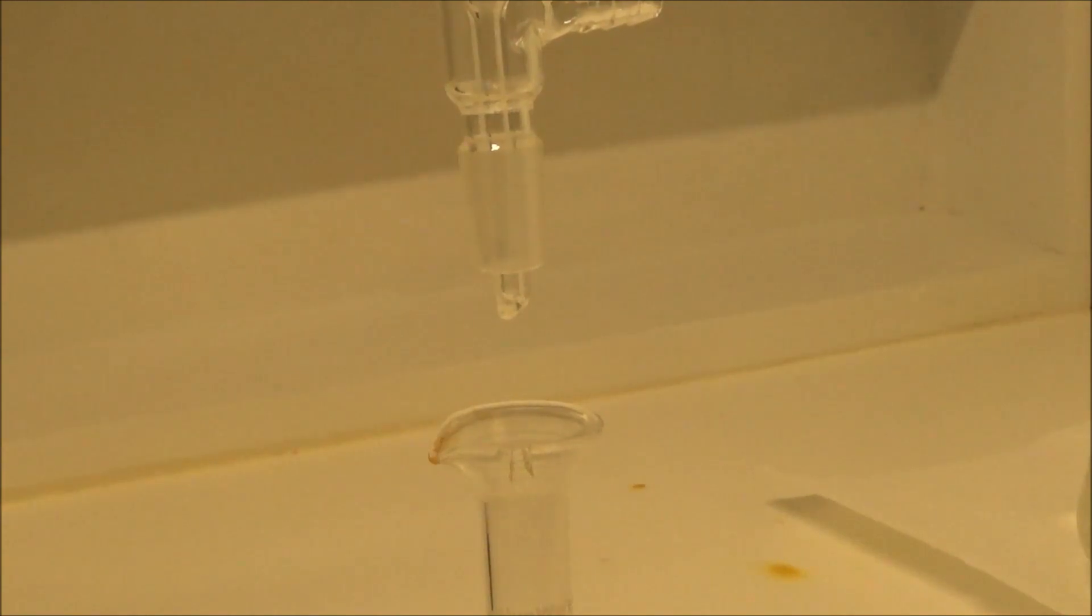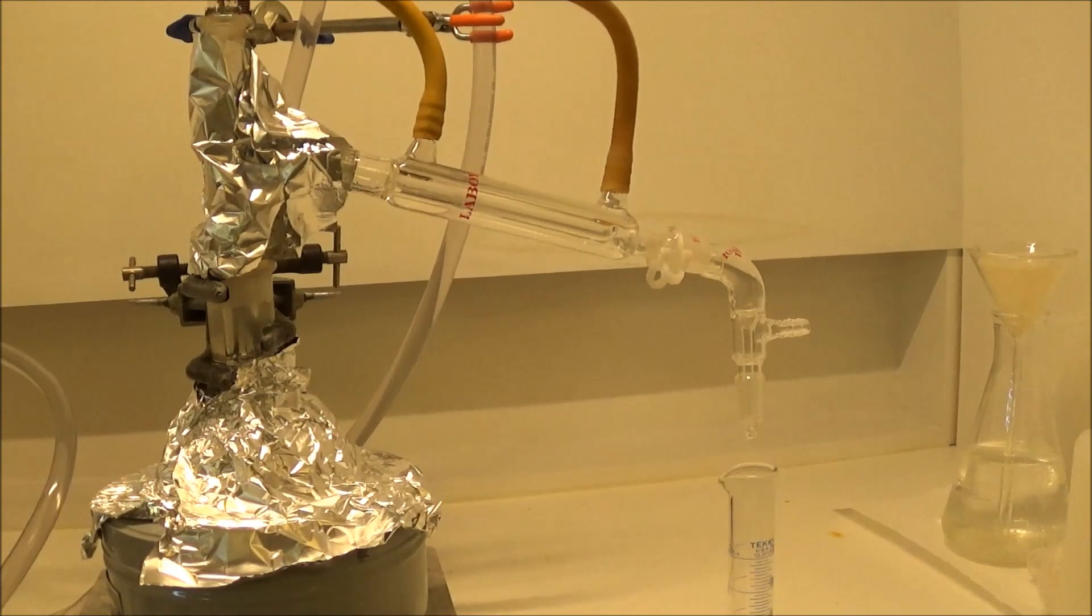I discarded the first few drops, although there didn't appear to be anything low boiling. After that, I collected everything between 166 and 168 degrees, before the still head temperature started dropping.